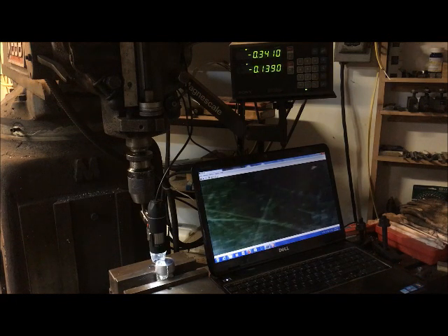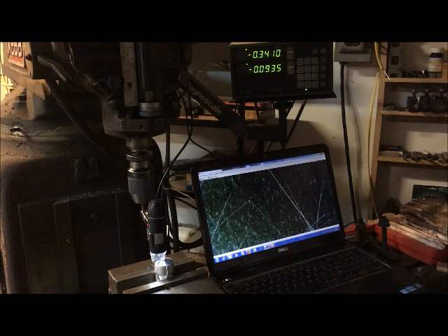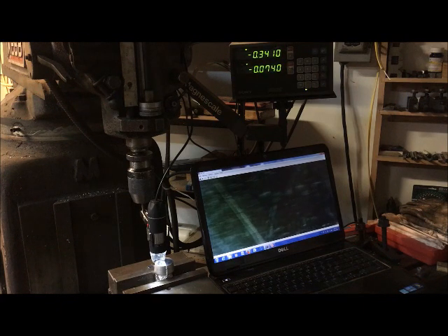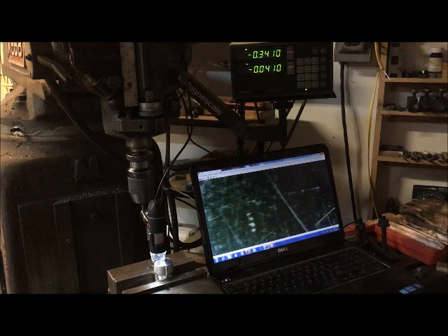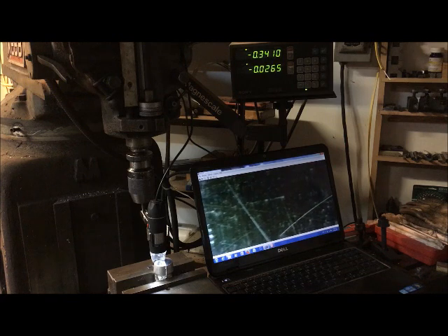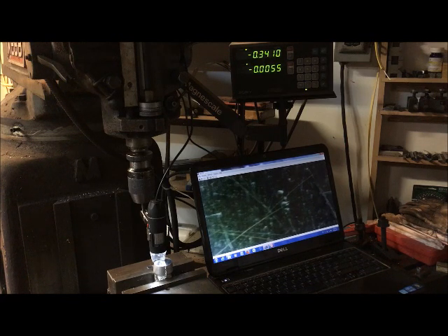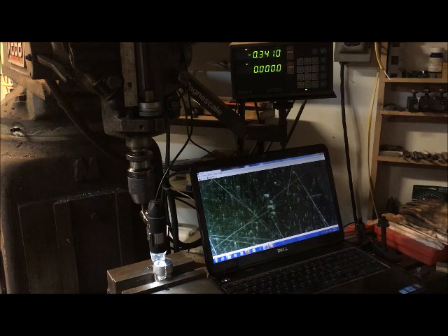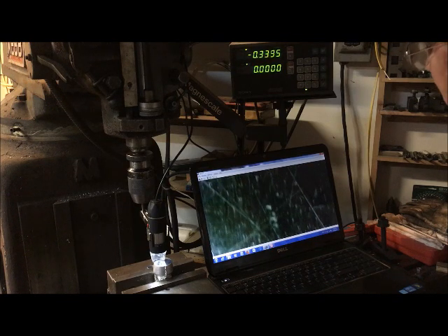Now if I've got the hammerhead leveled, I don't have to refocus it. But I suspect I'll have to refocus it. It doesn't have very big depth of field. I don't know what those four little things are. And I'm not real good at polishing, but for defects on the order of 3 or 4 to 10 thousandths, I can find them.